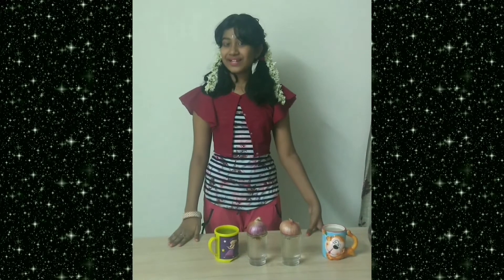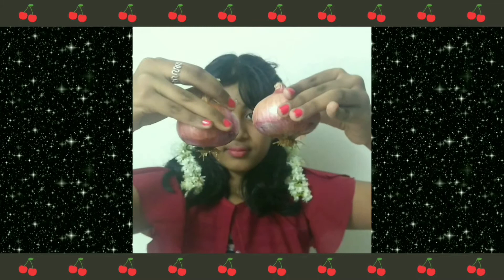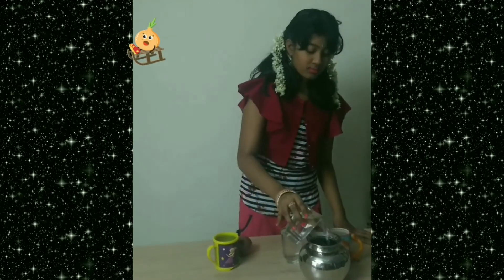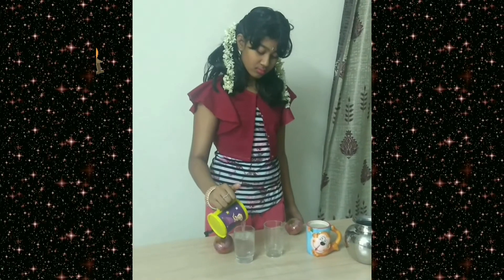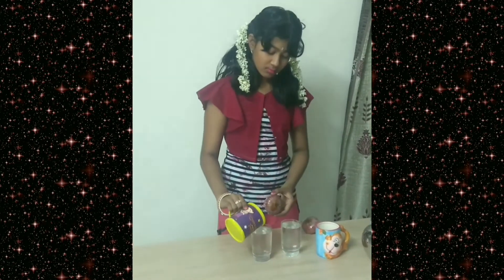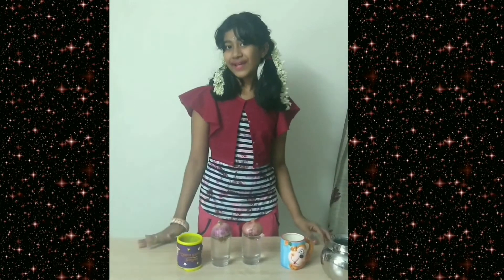Today we have completed 3 days after we started the experiment. Let's see if there are any changes. The roots have grown a little bit longer. Let's replace the water. Again we will see what will happen after one day.